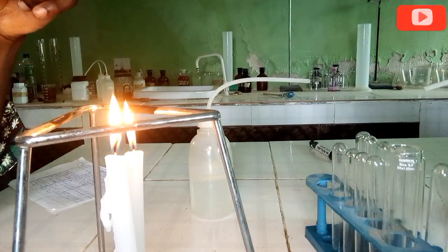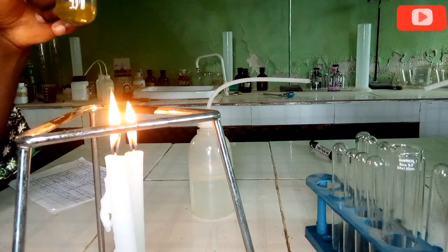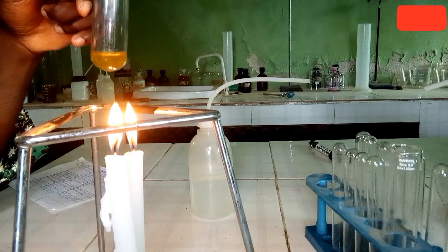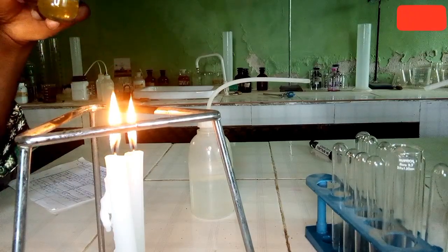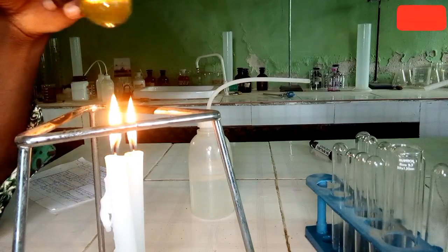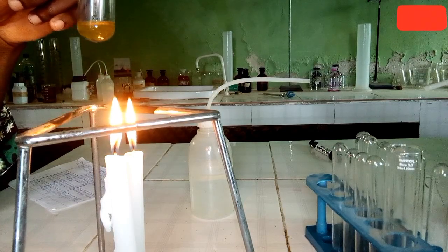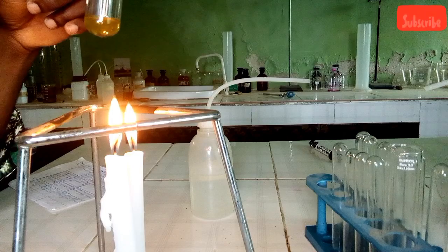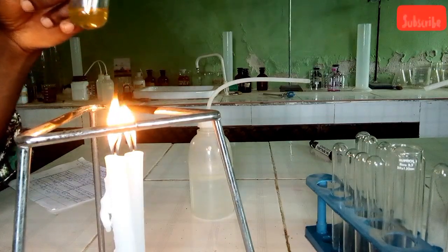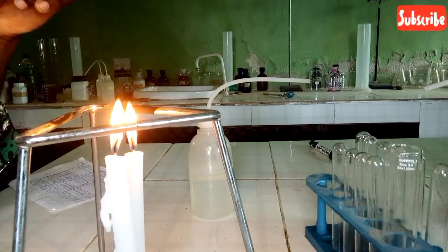Then aqueous solution plus acidified KMnO4 or K2Cr2O7: we kept that and it changed color to green. Then for this last test we are doing now, we discovered that the color changes to blue as we heat, but as we continue heating, we started seeing a brick red appearance. So in each inference, when dichromate is added, the inference is that probably an alkanal or hydroxyl group is present in this sample. So the sample is probably a reducing agent.